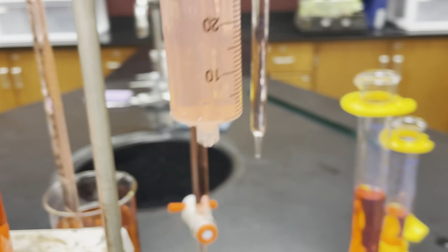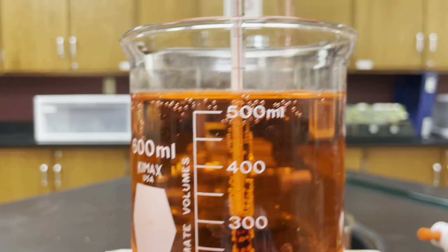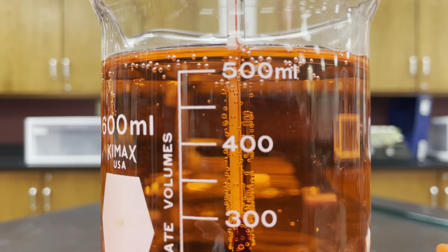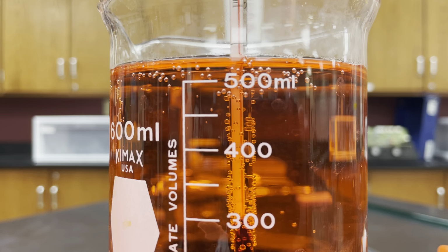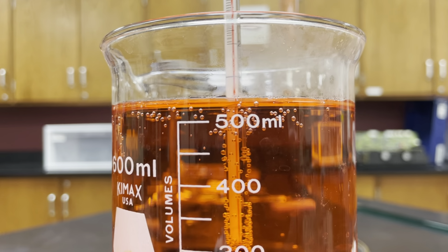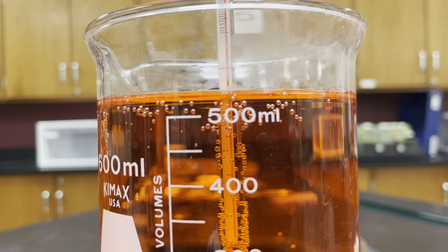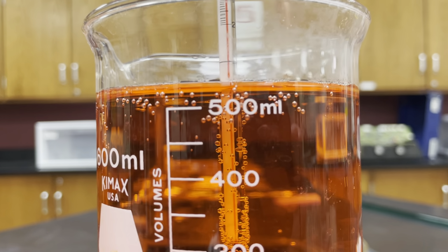Now a couple other kind of strange examples. Let's say you have a container like this, where your markings stop, but you have liquid above that. Can we eyeball that and say, well, between the 400 and the 500 is 100 milliliters, and this looks like it's less than the 50 milliliter difference between 450 and 500, so maybe this is like 530 milliliters and we ballpark it? Not really. Once we get past the line where we're making the measurements, that's invalid. Even if you have really good eyes, maybe you try and measure it out with a ruler or something, do some kind of ratio.